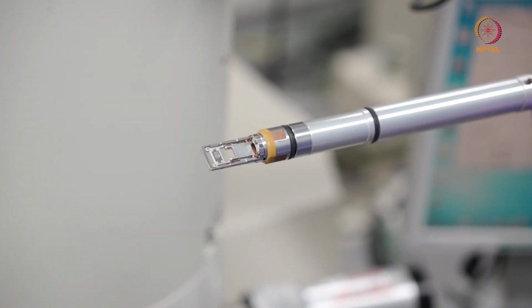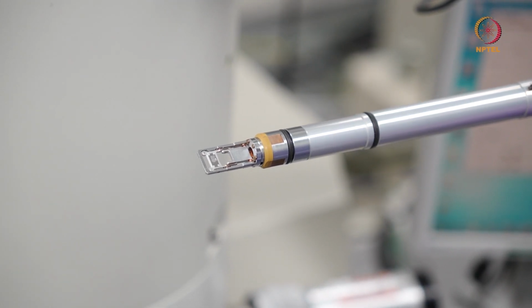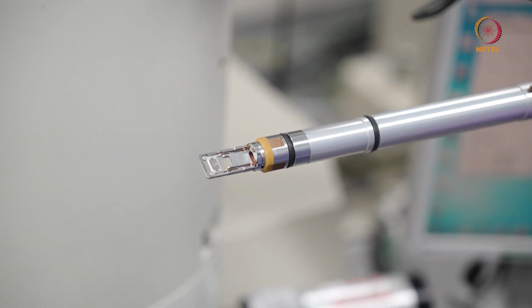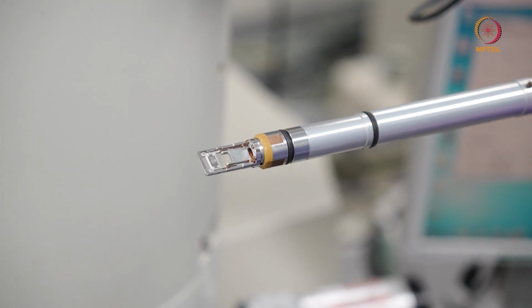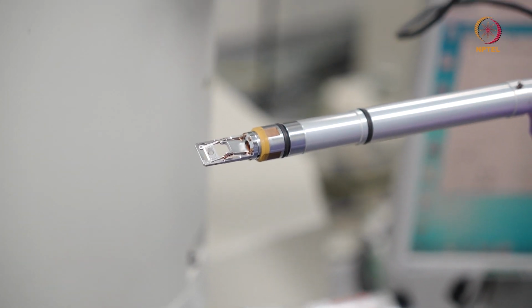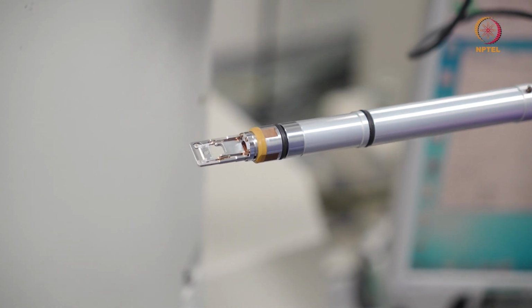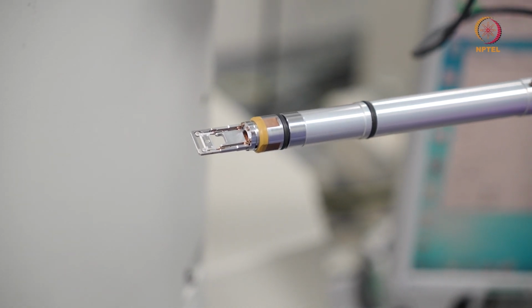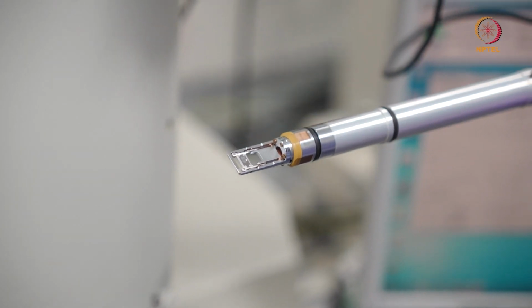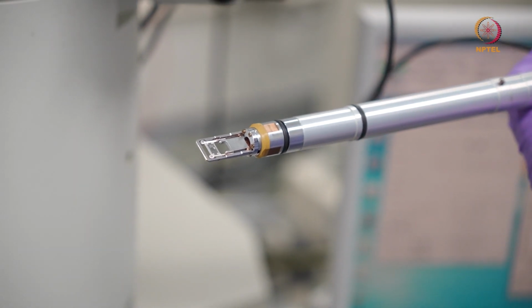So this is the double tilt holder. So the primary tilt is along the axis of the microscope, which is like this. And the secondary tilt or the beta tilt or Y tilt as it is called is where this cradle moves up and down. As you can see, the tilt is restricted within plus minus 15 degrees for the secondary tilt and about 30 degrees for the primary tilt for a typical microscope.